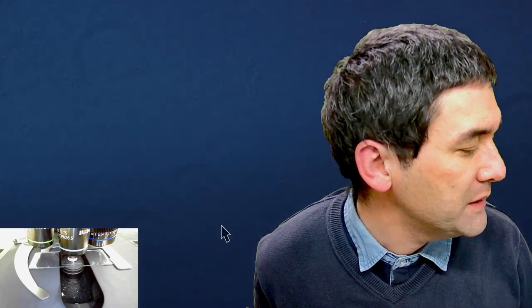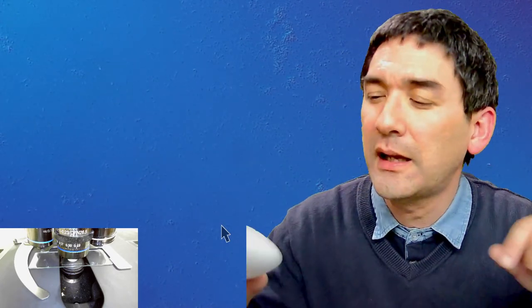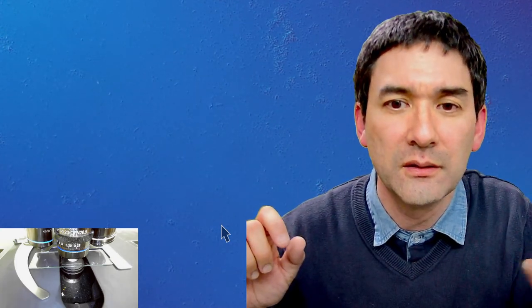Now I'll switch to DIC (differential interference contrast) at 60x for comparison. In DIC, the bacteria appear brighter on one side compared to the other — creating a pseudo-3D shadow effect. I can also change the background color to increase contrast. DIC and so-called oblique illumination look very similar, as someone in the chat noted.